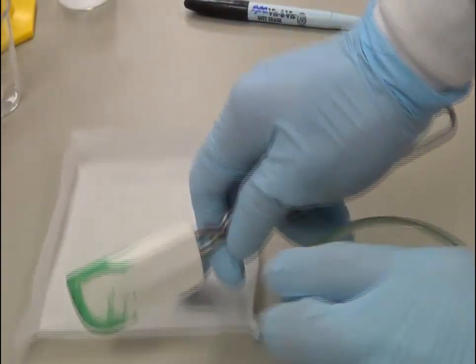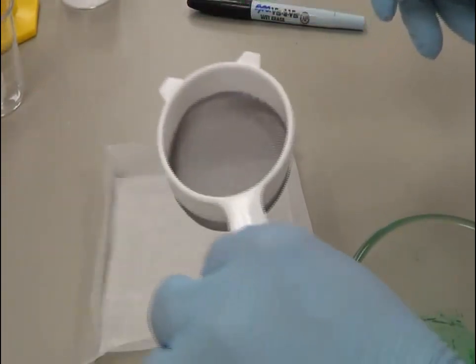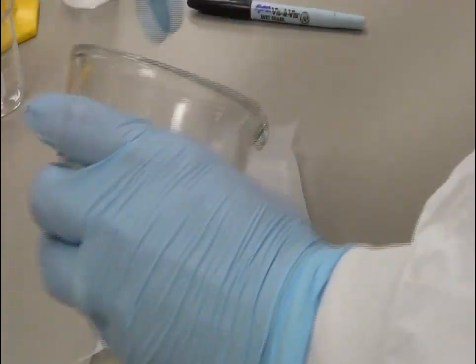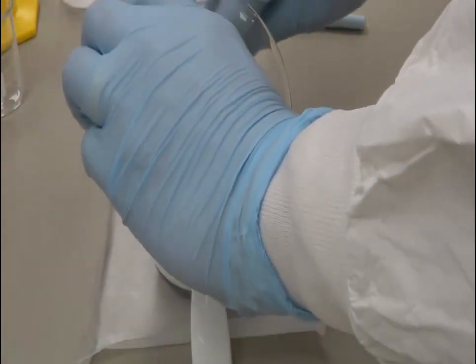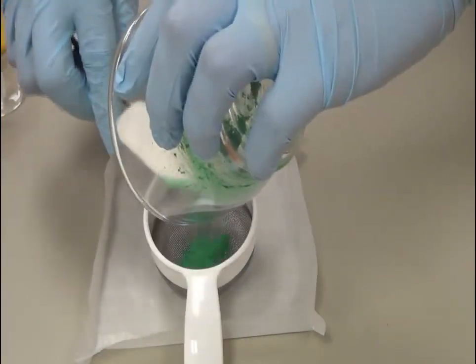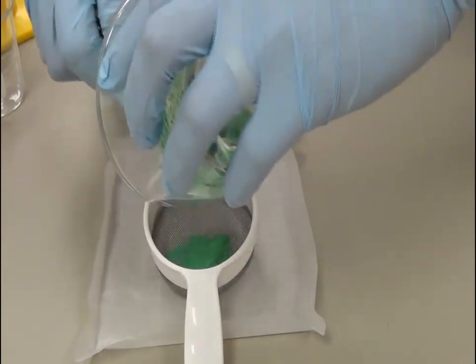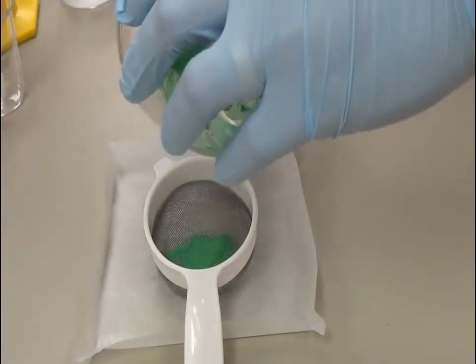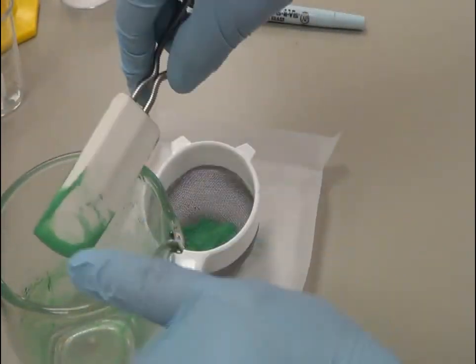I am going to use this weigh boat and spatula and place everything in it. You can use either a plastic weigh boat or a paper weigh boat, whatever you like. I am transferring the homogenous mixture now and will leave this aside and come back to it later.